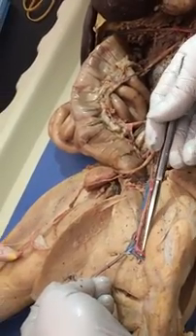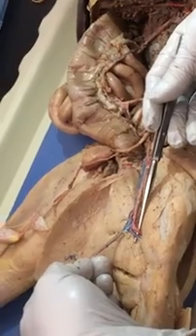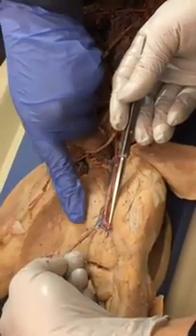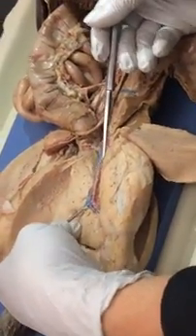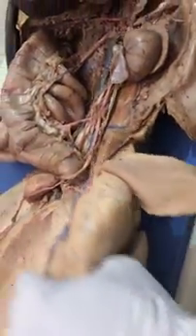Or popliteal, whichever. Will you pin it from the back as well? Only for tibials. Okay. Only pin the tibials on the back. And then the, it has a name, but I don't know it. And then the anterior and posterior tibial. Okay, so you ready to flip? So those will be the only ones that will pin flipped.